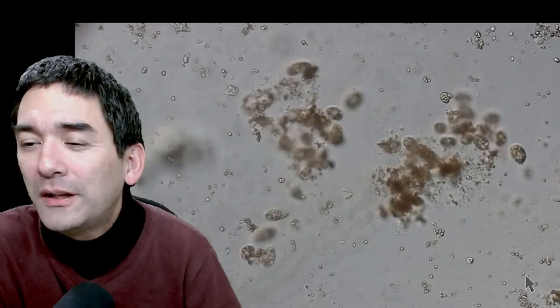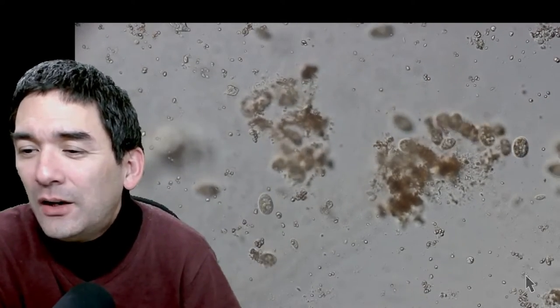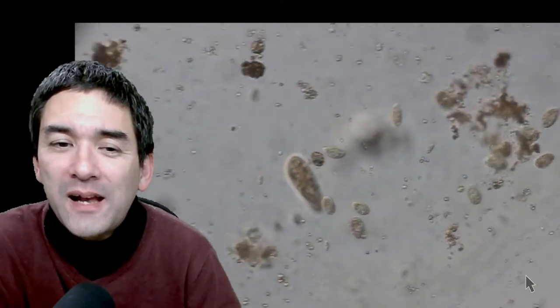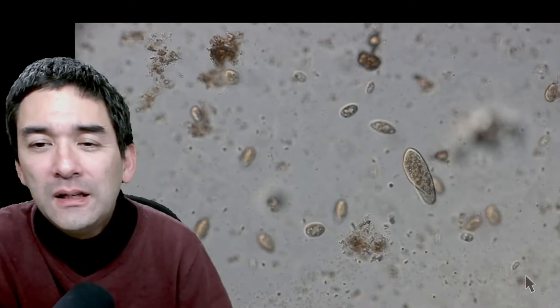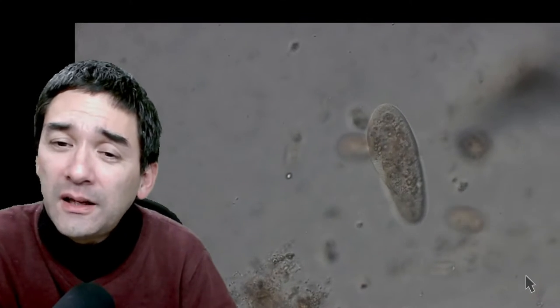Lots of moving dots in a water sample can be bacteria. Water bears are also one of the things — I've had some moss samples where there are many of them and then others where they're very difficult to find. What you do is take a moss sample, add a little bit of water, wait a few days for the moss and water bears to regenerate, then try to rinse them out. You have to be very patient to find them — they like to cling on.